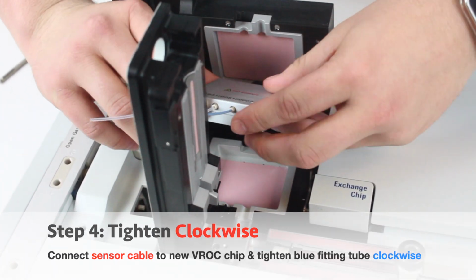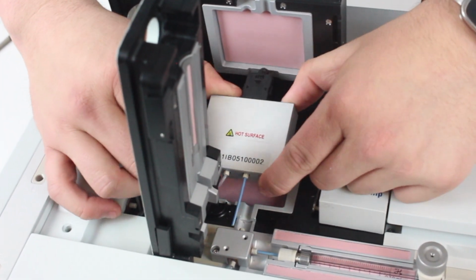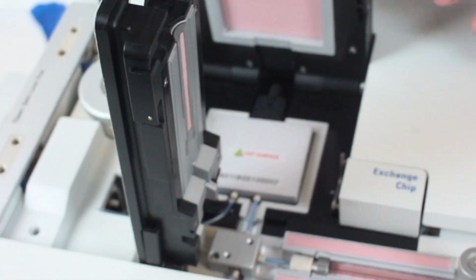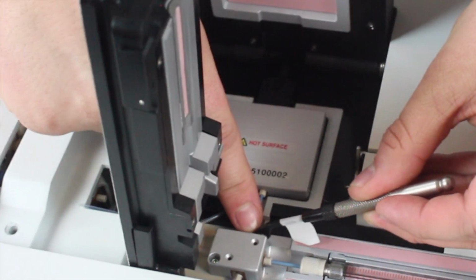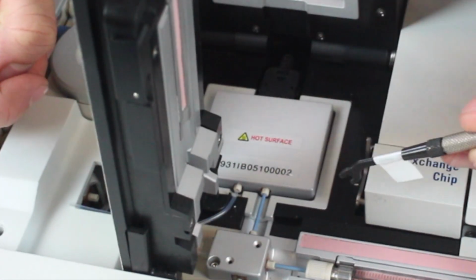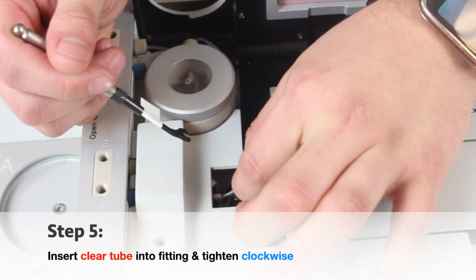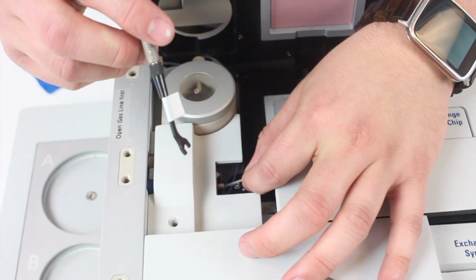You can then take your chip and then sliding the blue peak fitting tubing into this fitting down here that you pulled it out from before, and then slide the chip into the casing. You can then take your wrench and tighten this fitting right here connected to the blue peak tubing clockwise until it's tightened. You're then going to take the clear tubing and put it back into the fitting that you took it out of. Just slide it in, and then you're going to tighten the fitting clockwise until you can't tighten it anymore.